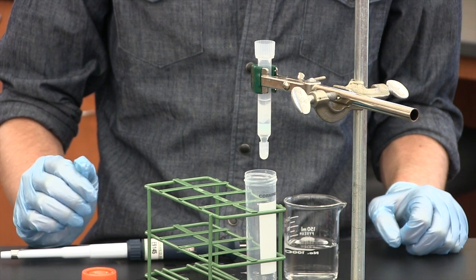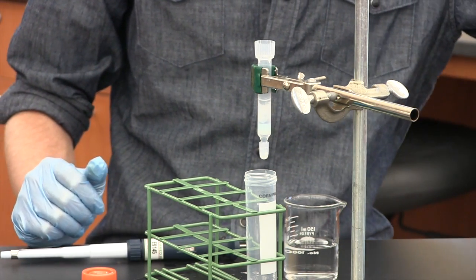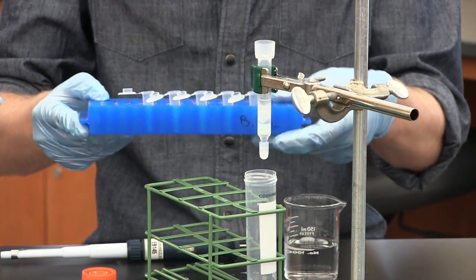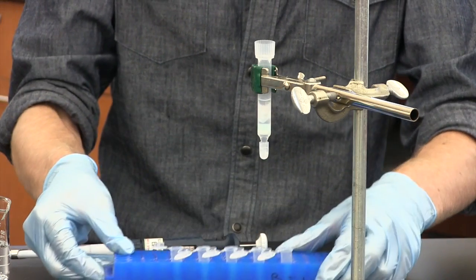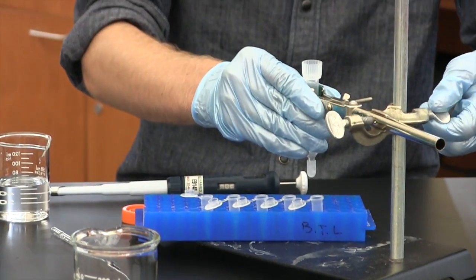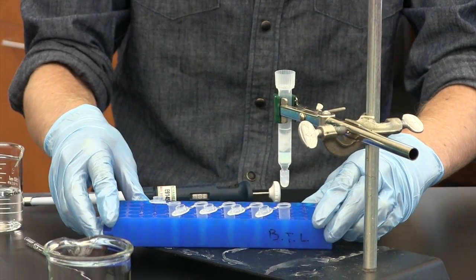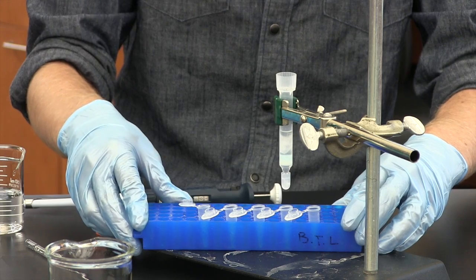The next steps are to wash and elute. For those steps, you collect fractions. You'll want to have your tubes labeled and arranged in a rack like this. Then you can collect one or one and a half mil fractions, whatever you need, by just sliding the rack underneath. You'll fill a mil and then you can slide it to the next tube. And that's it.